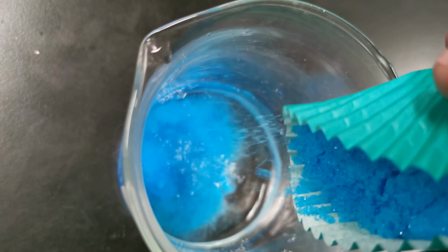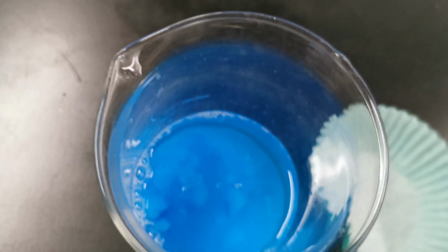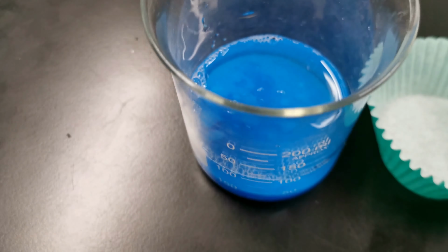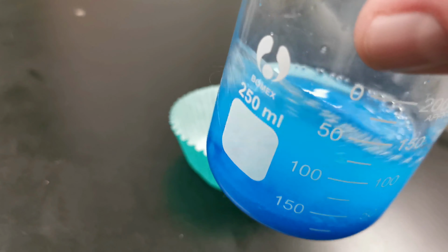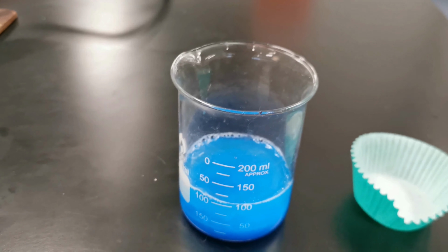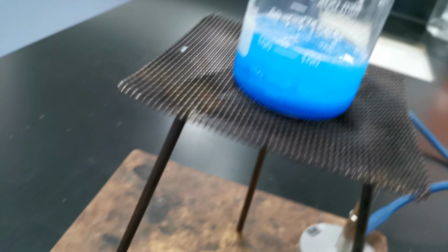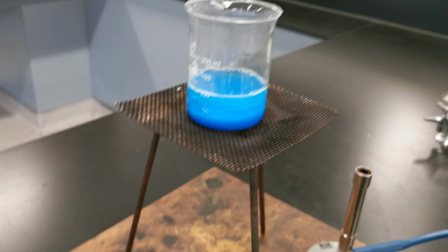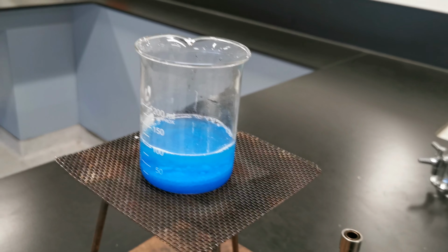So if I had 100 mils of water, I could dissolve 20 grams of copper sulfate. Well, I've just put in 56 grams and I don't actually have 100 mils of water. This is not all going to dissolve. 20 grams of this will dissolve if I'd had 100 mils, so a bit less than 20 grams. In fact, what about 15 grams since I've only got 75 mils. But what I'll do is I'll actually heat this up. Let's get a Bunsen going and we'll heat it up, because when you heat a solution, you can dissolve more salt. So let's just fire up this Bunsen.